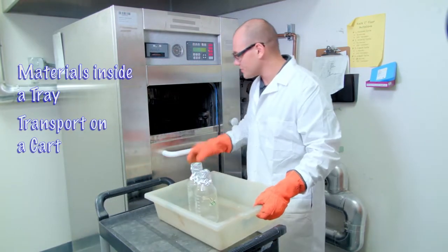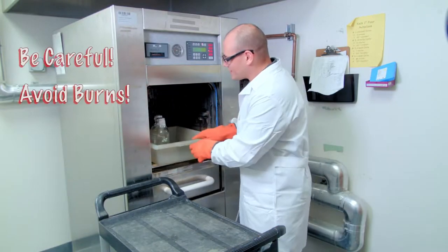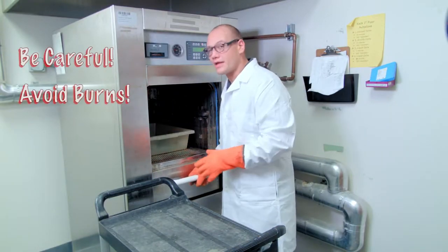Whenever loading materials into the autoclaves be very careful not to burn yourselves as the sides of the autoclave will remain hot between loads.